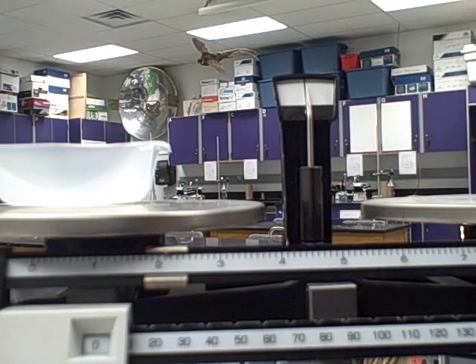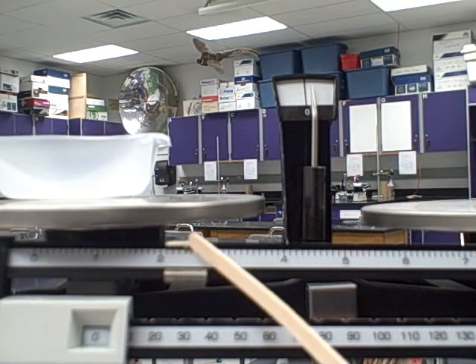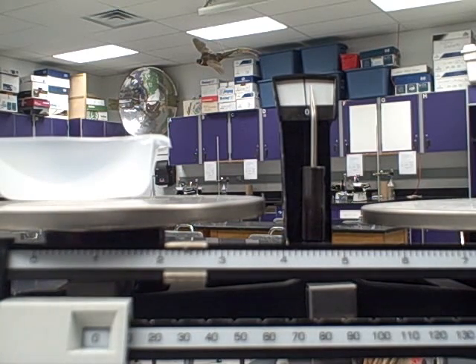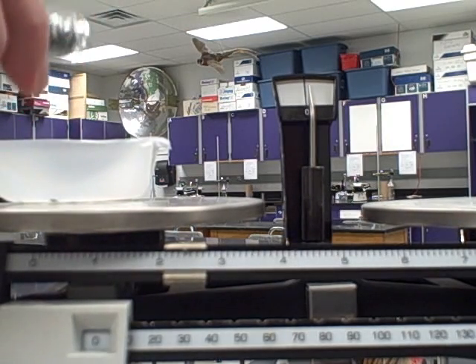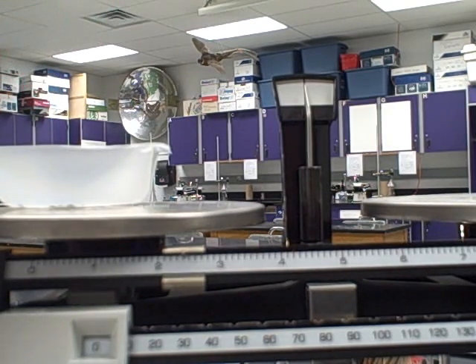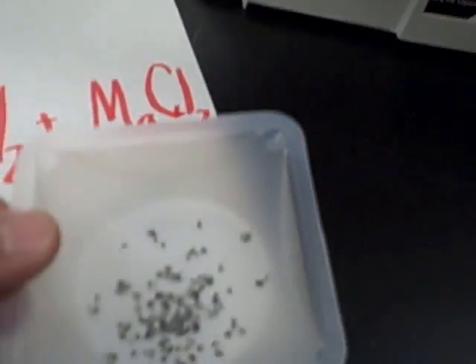A tenth of a gram corresponds to the tiny lines after the gram numbers. So going from 2.1 to 2.4 means I've added 3 tenths of a gram. We're talking small amounts because we don't want the reaction to get out of control. You set your scale to what you want, then very carefully — like sprinkling in a little pepper — add a small amount of magnesium until the balance balances again. If you have a big heaping pile, you've added 3 grams, not 3 tenths, and that would be bad.